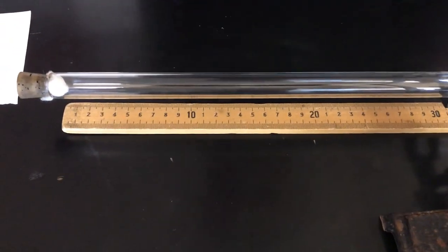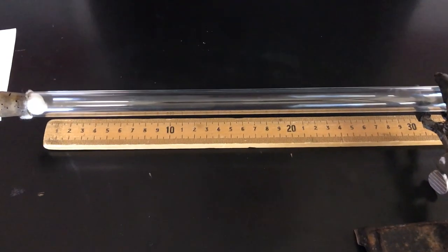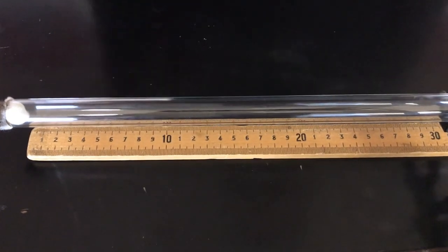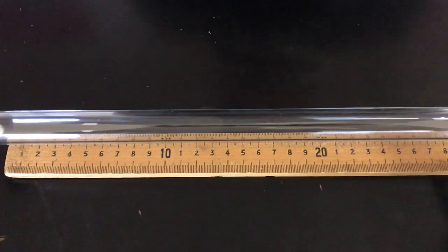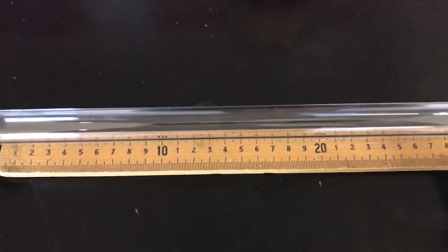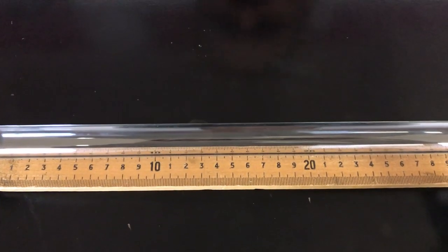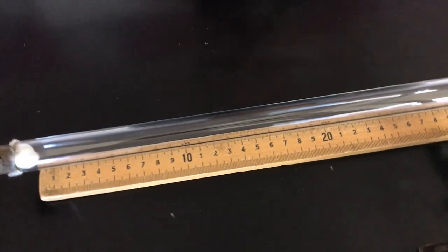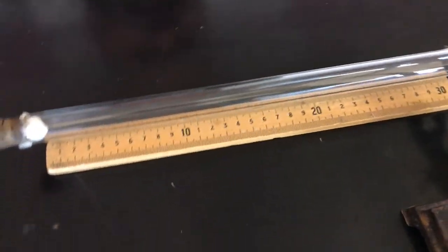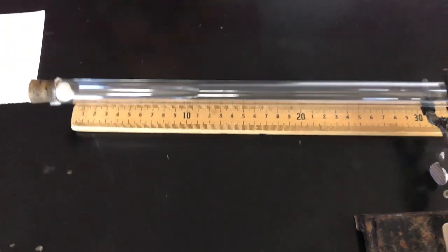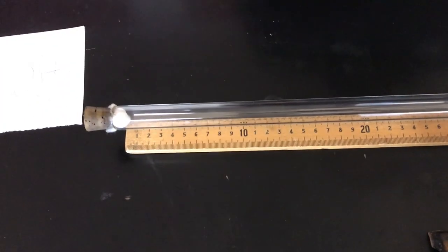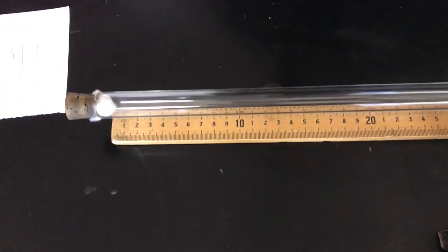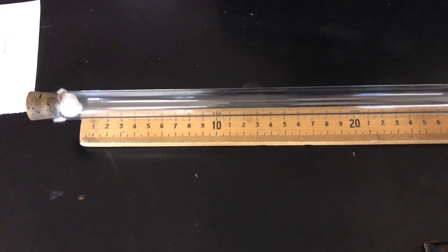Sometimes we do this as a lab. We would have done it with you guys as a lab and had you do it. And you'll just see this white ring form inside the tube.